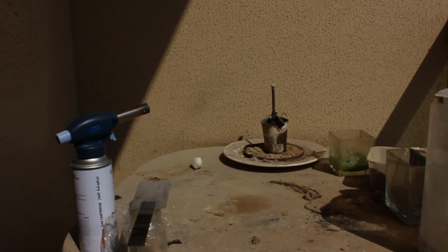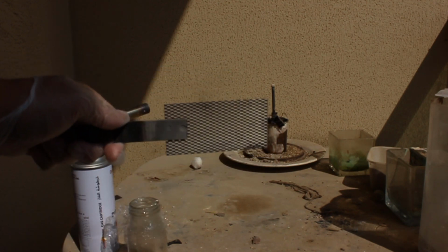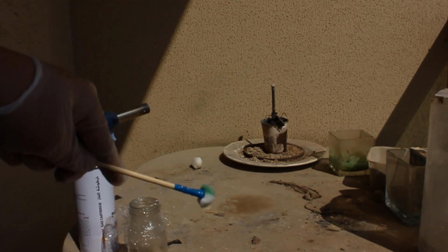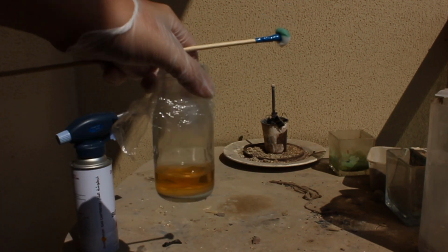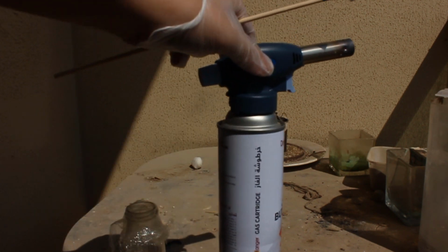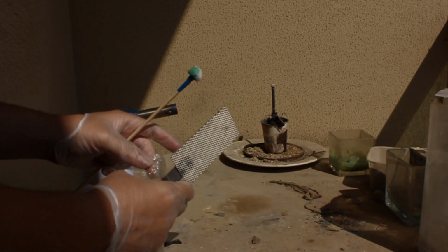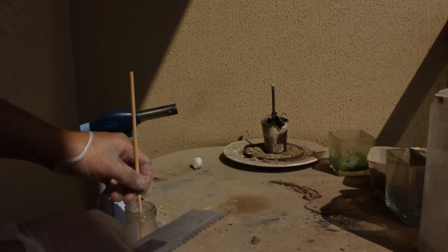Okay, people, it's nice to have two hands for once. So I got our electrode right here. I got a paintbrush. Over here I got our special plating solution. And here's what we're going to use to bake it. So hopefully I can get everything in the shot. So what do I do first?